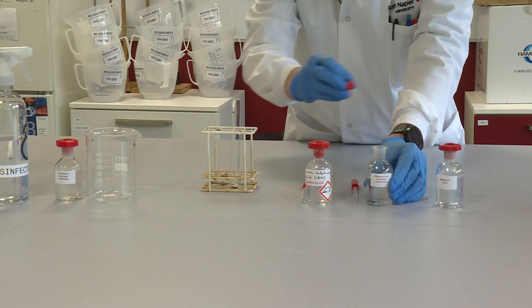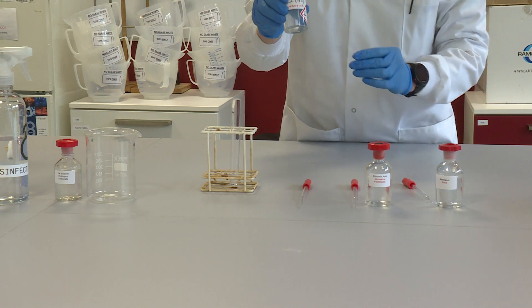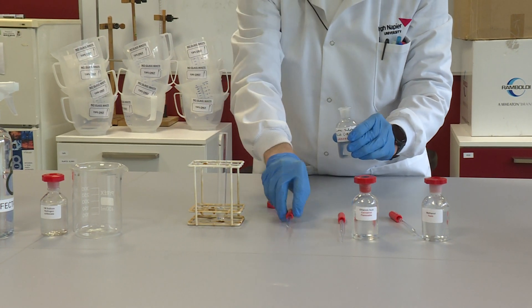Then we want to catalyze the reaction. The catalyst I'm going to use is concentrated sulfuric acid. I'm going to add five drops of concentrated sulfuric acid.